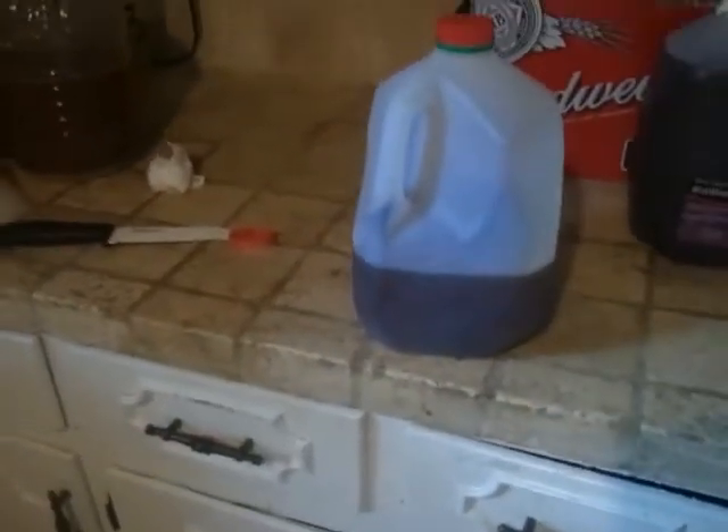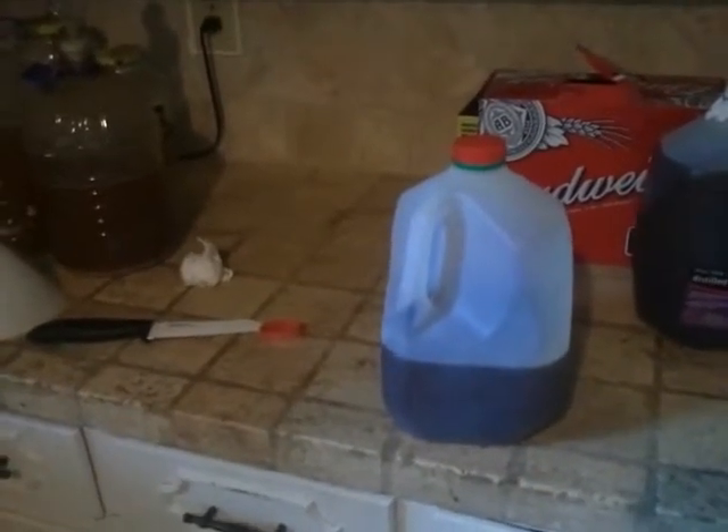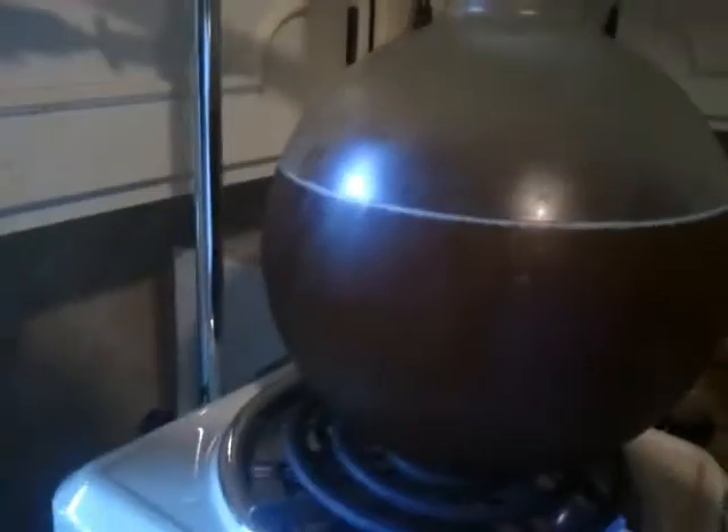I've got my glasses. I'm using a water mixture — it's about 10% alcohol. I'm gonna put it in the still. I've got it all set up. A little bit of it ran down.